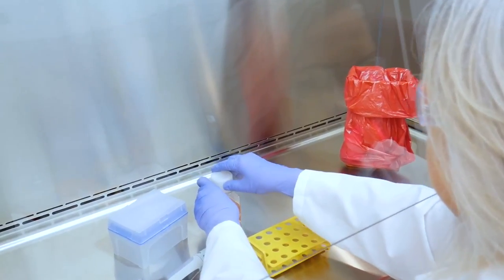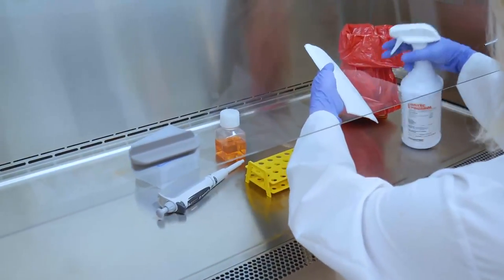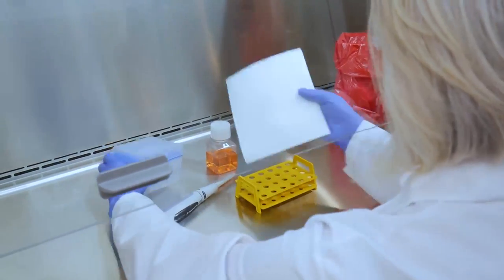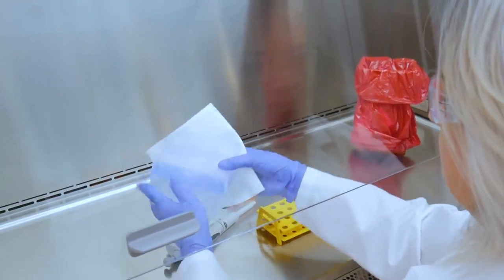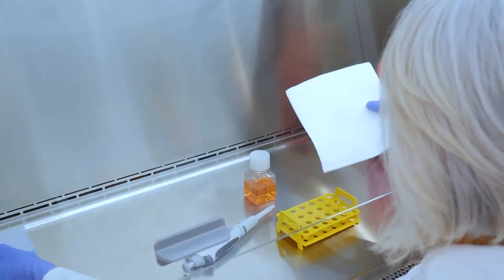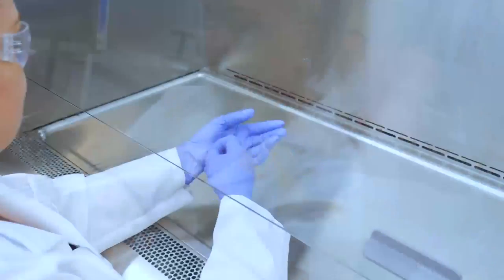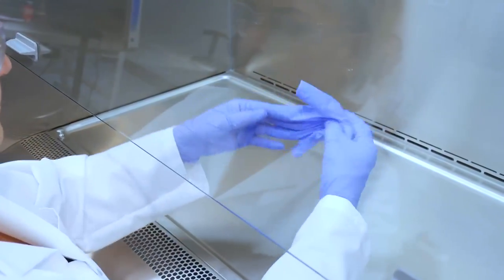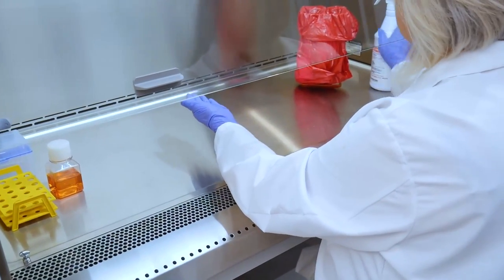After completing all work, carefully close up any open vessels. Next, wipe down the outside of all materials before carefully removing them from the cabinet. If double-gloved, remove the outer pair of gloves. Otherwise, disinfect hands before exiting the BSC.